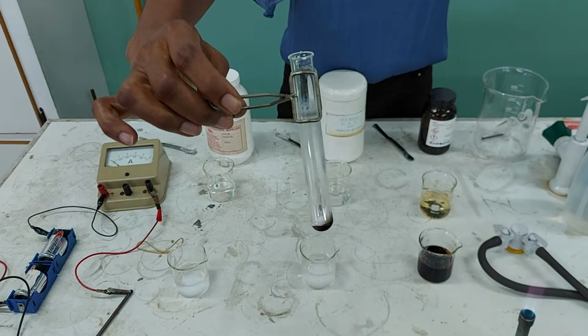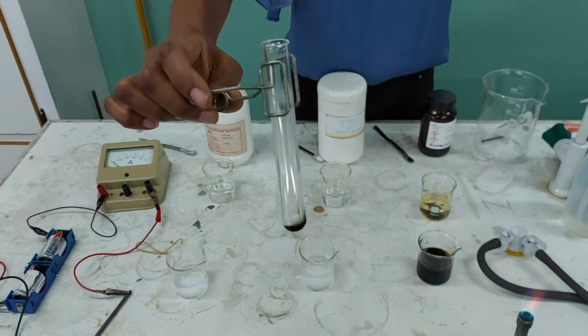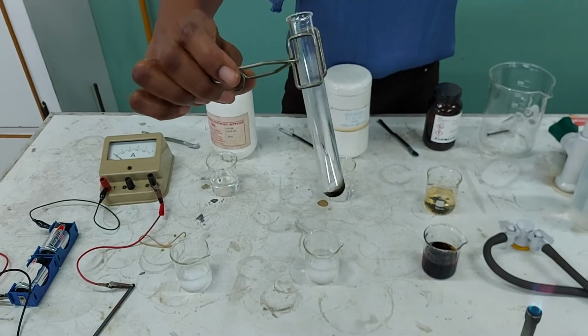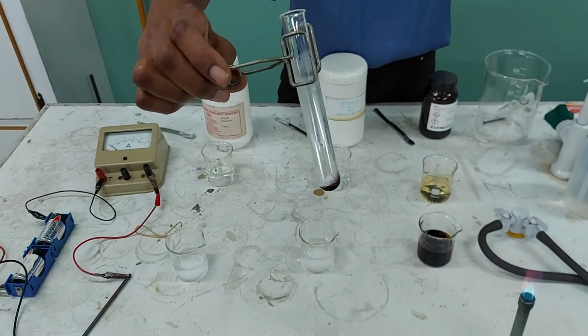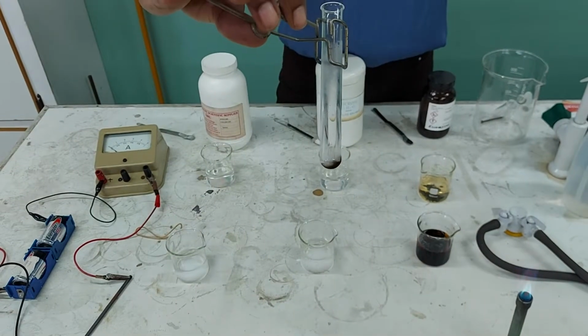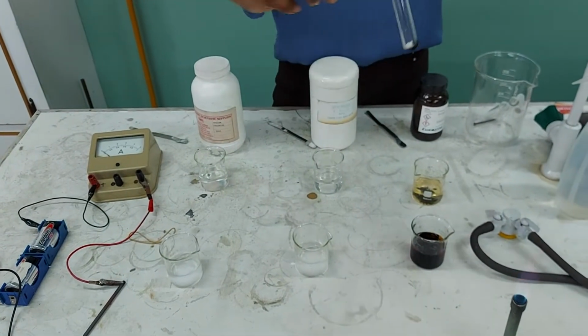The black soot is coming from the initial luminous flame of the Bunsen burner. The Bunsen burner went out shortly after we tried to switch it to the non-luminous flame, okay? But you'd also be able to see in the test tube to make some further observations. This is for sodium chloride.